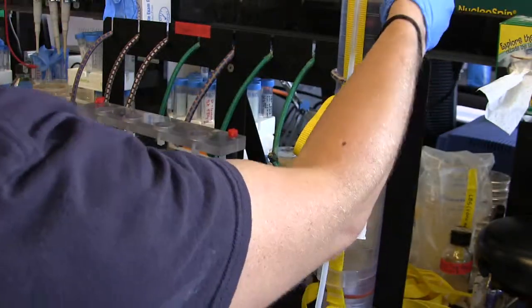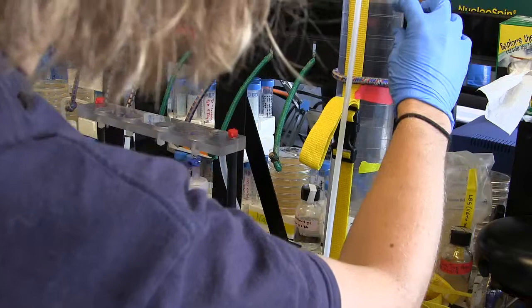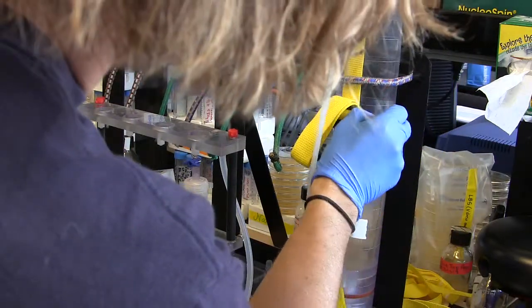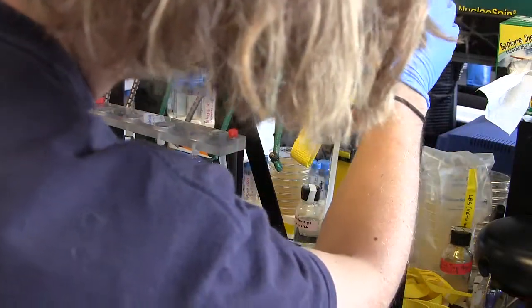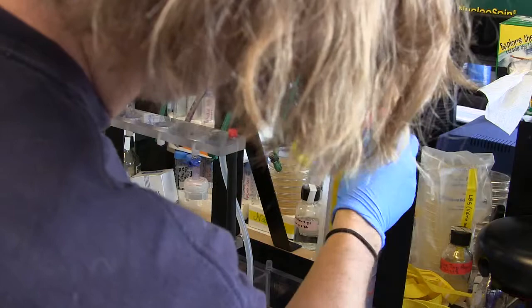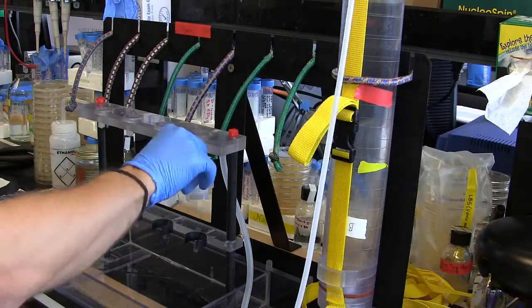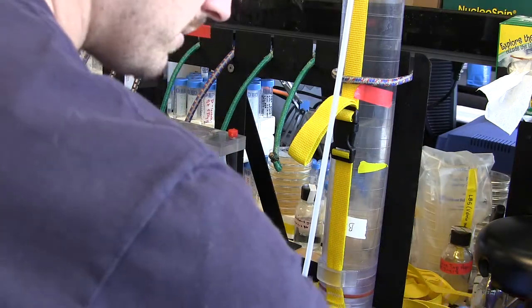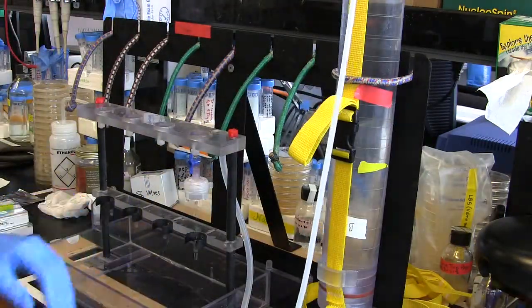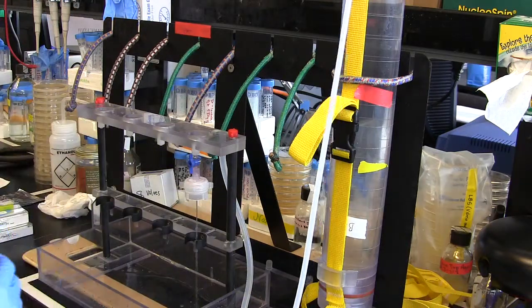Count off five 100-mil increments and mark it with tape. Then all I do is open it up — the flow should be not super fast but not really slow either. I double-check my pressure — still on three PSI, so that's good. I increased the pressure a little bit and now it's flowing really nicely. Just let that drip through.